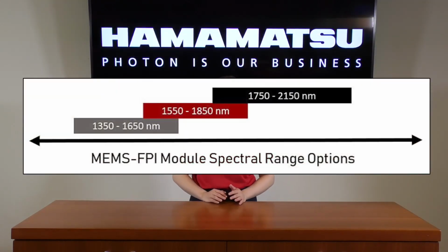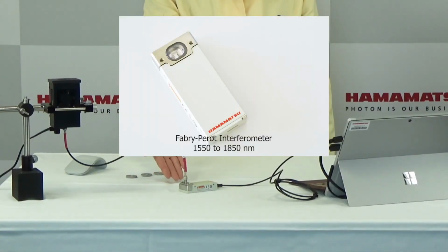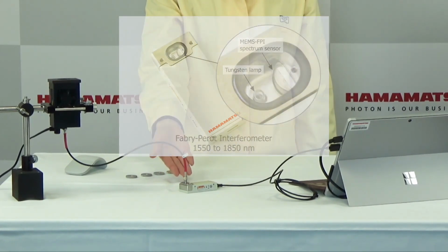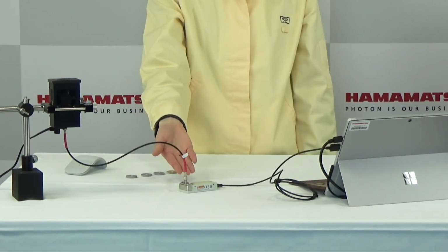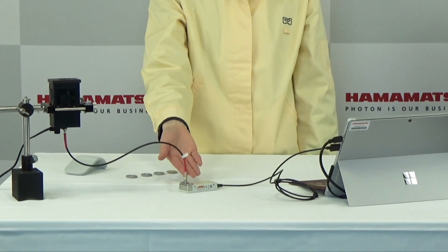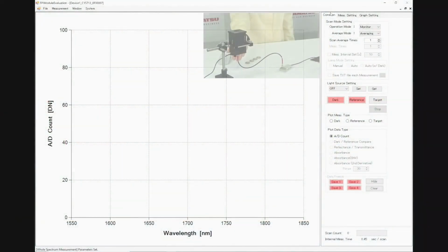While the MEMS-FPI module is limited in terms of spectral coverage and resolution, it excels significantly in terms of cost and compact size advantages. We'll now use the MEMS-FPI spectroscopic module to perform a measurement. When we operate this module on our software, we have the ability to turn on and turn off the integrated tungsten lamp. For this test, we'll leave this off, using an external light source instead.